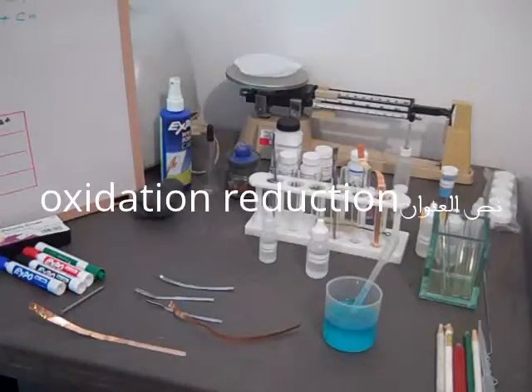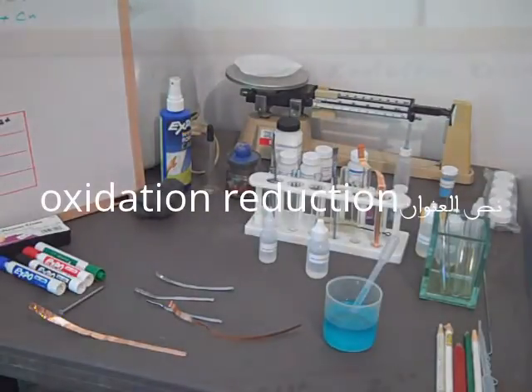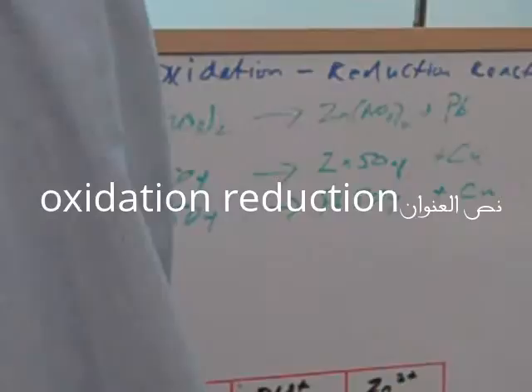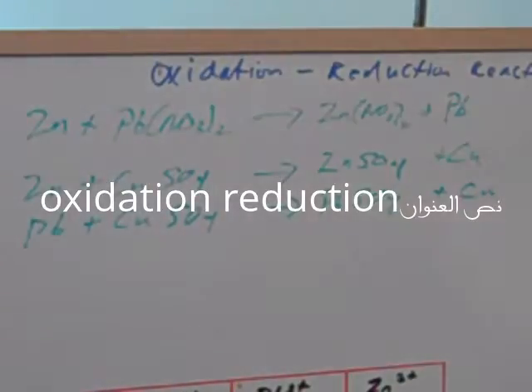Let me show you now what we expect to happen. It's always good to get an idea of what you expect before you do the experiment. We already checked the activities of the three metals we're using—the zinc, the lead, and the copper. We found that zinc is more active than either copper or lead. Lead is more active than copper.